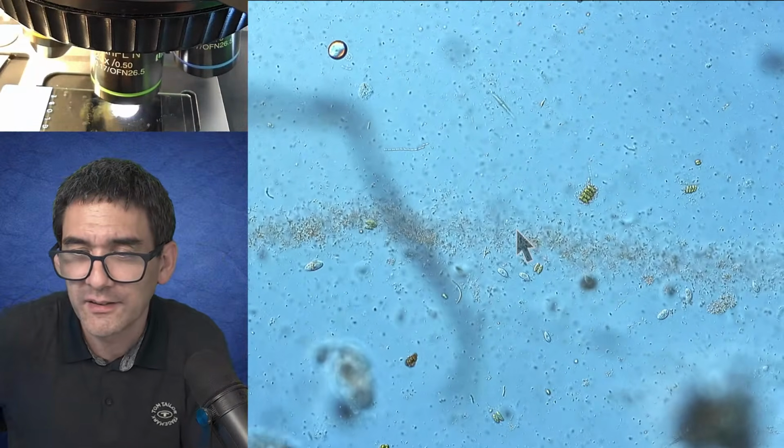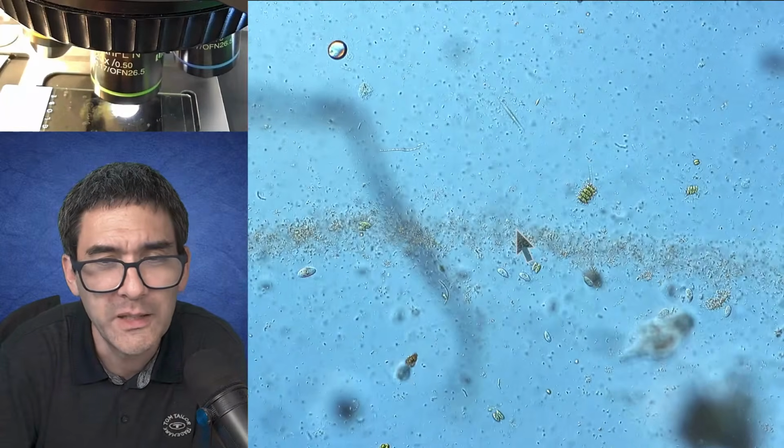They follow a gradient. Yes, they follow an oxygen gradient. You have to be a little bit patient here.